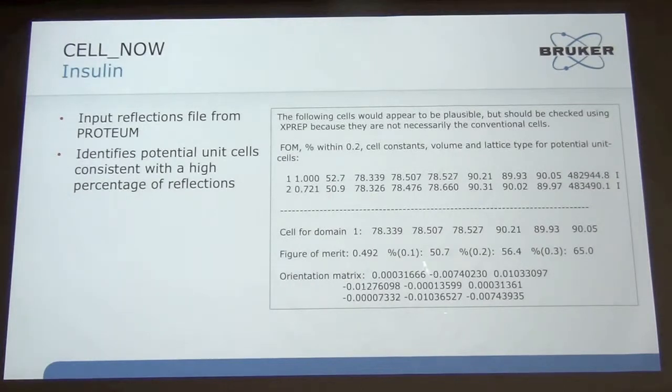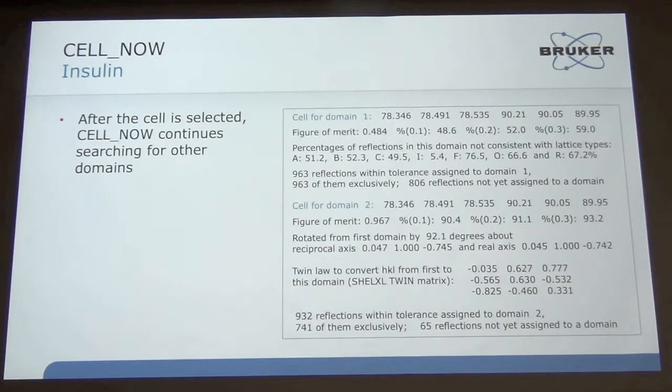In this case, this is the insulin I was showing earlier. For CELL_NOW, you just put in a reflection array. It comes up with potential cells. You select the one you want. It then tells you what the orientation matrix for that cell is. And then if you tell it to go on, it'll keep looking for the next domain. In this case, it found domain number 2. It tells you what the orientation matrix is, and this is the relationship between the domains. And now you've essentially detwinned it. So it's an automatic way of taking a reflection array and searching for two different domains.